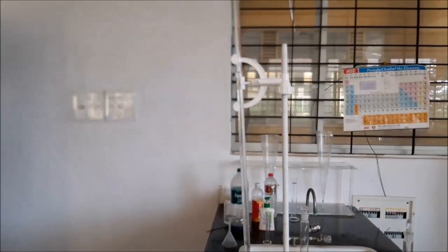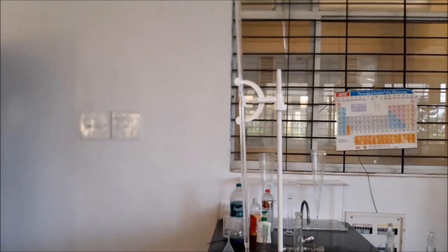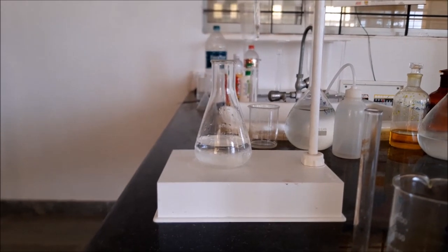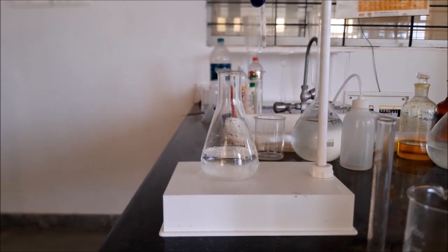The burette is filled with standard sodium thiosulphate solution. We have taken 100 ml tap water as a sample in the conical flask.